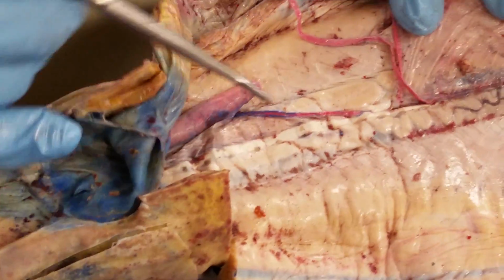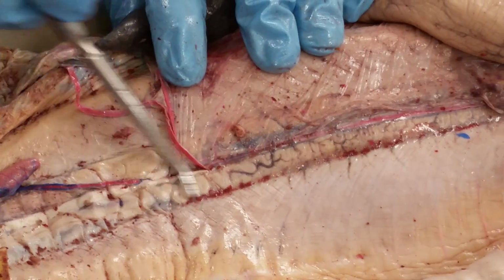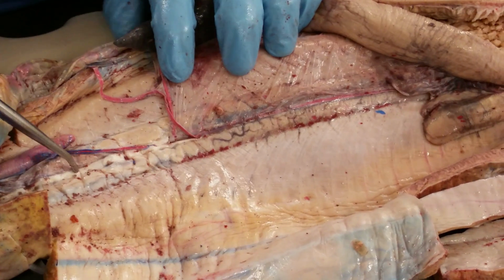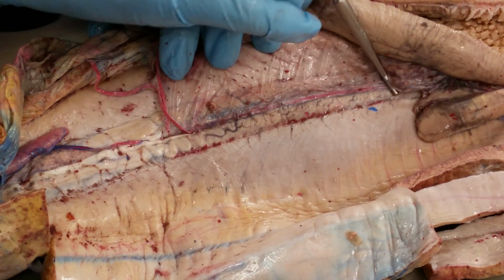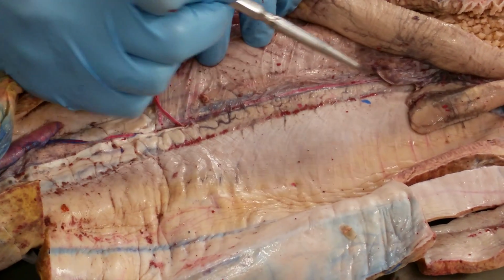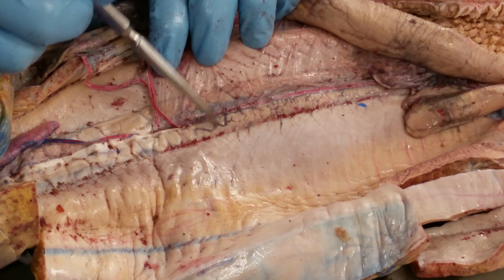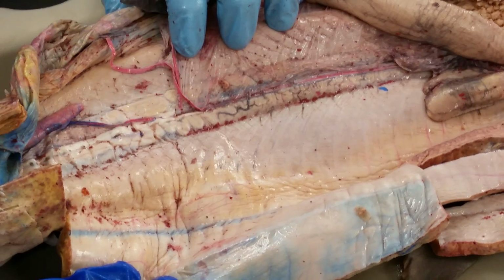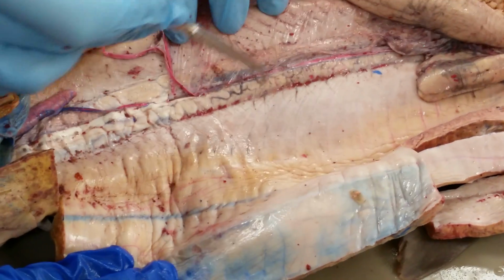Right, and then also wanted to point out the kidneys. So these are the kidneys running along either side of the backbone, the white things. Now, in females, this is all the same color all the way up and all the same structure, but in males, you can see this squiggly line running on top of it, and that's essentially the vas deferens that the sperm runs through, right? Because it goes from the testes down through here.